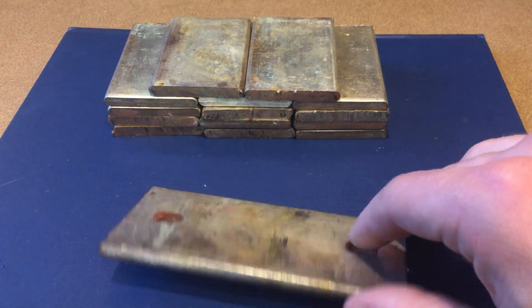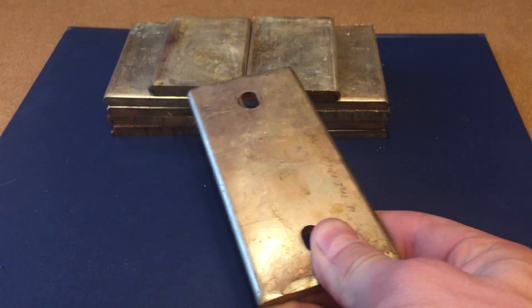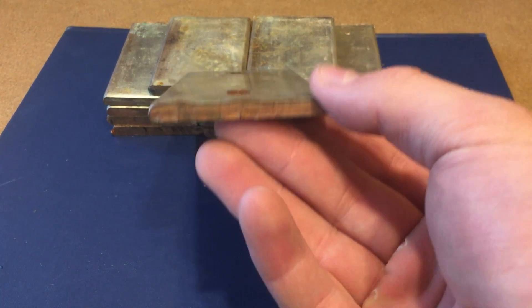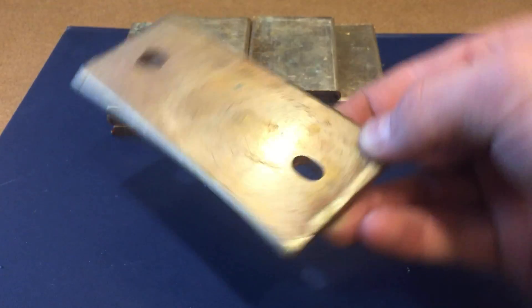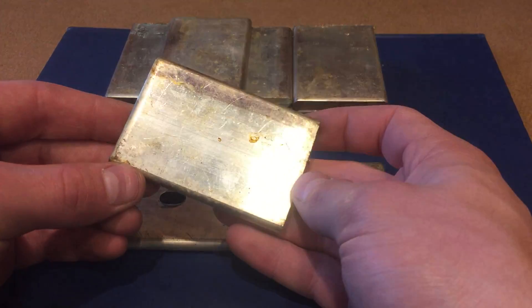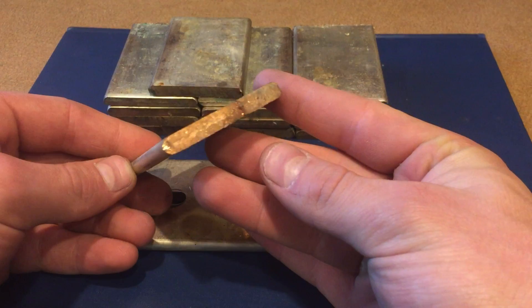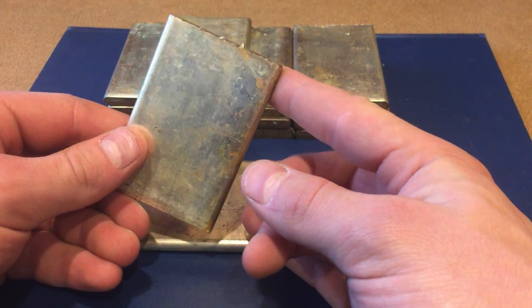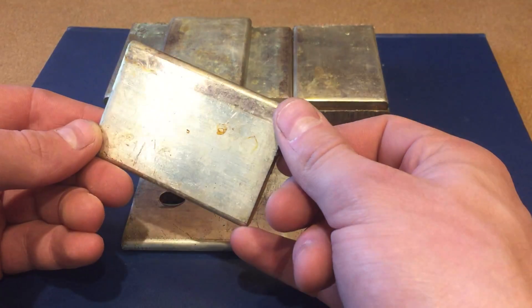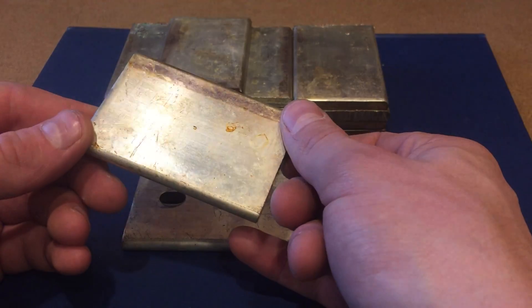Today I will be seeing if I can remove the silver plating from these end cuts of some copper bus bars. You can see that this is a very shiny coating on the copper and it's obviously silver. What is deceptive however is that the plating is only a few hundredths or thousandths of an inch thick, and in total I expect to recover less than a gram. Regardless, I'm going to try and extract it.